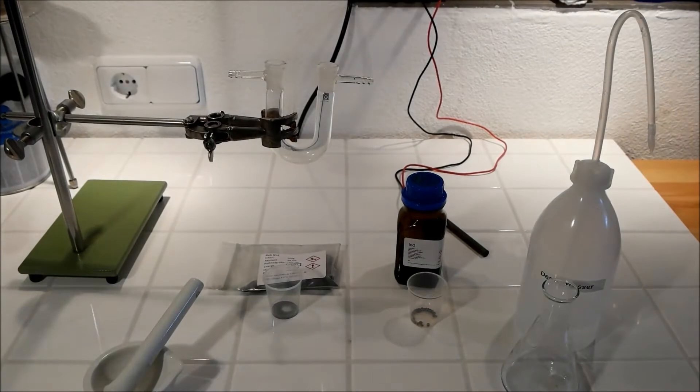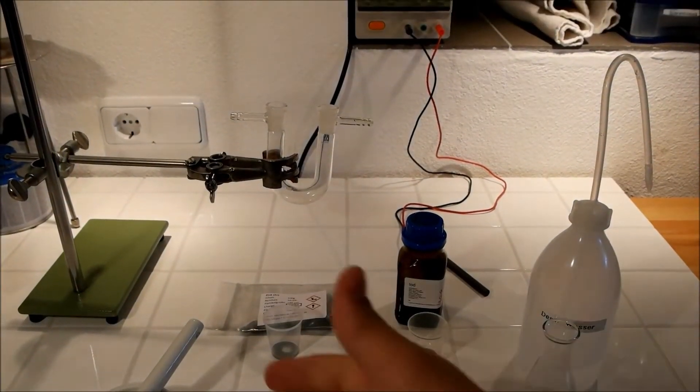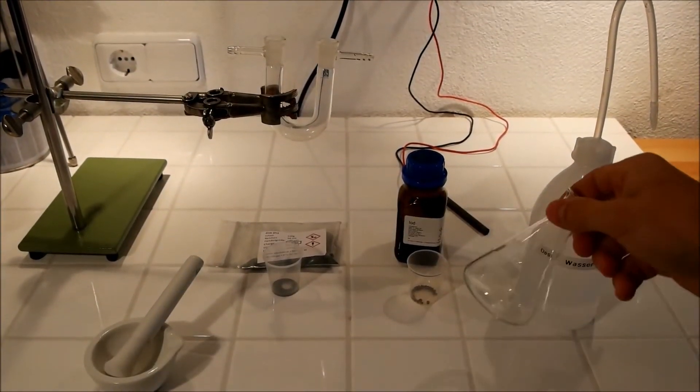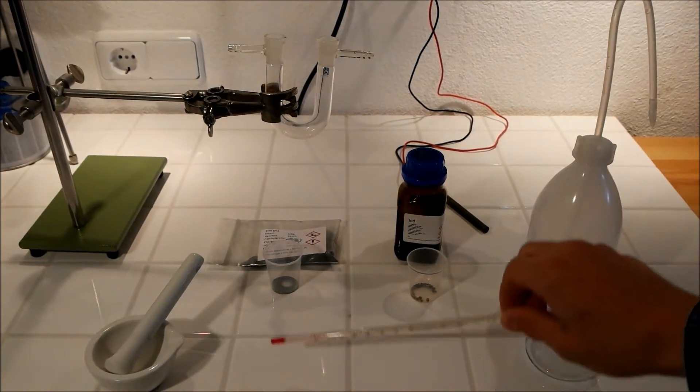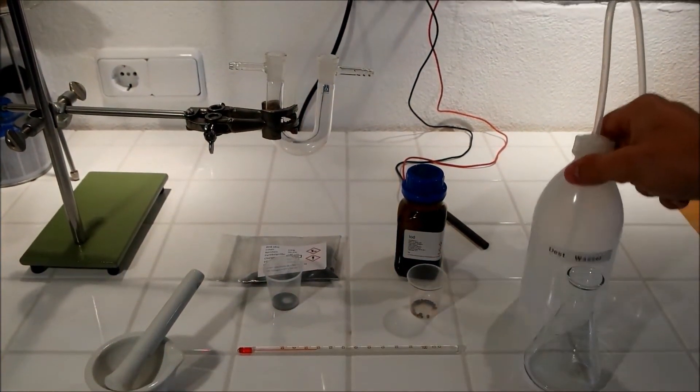Then some general lab equipment such as a mortar and an Erlenmeyer flask, a thermometer and some distilled water.